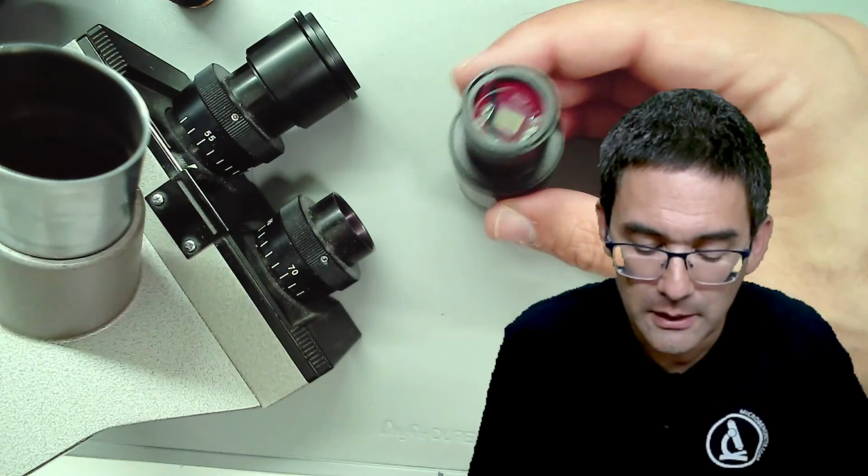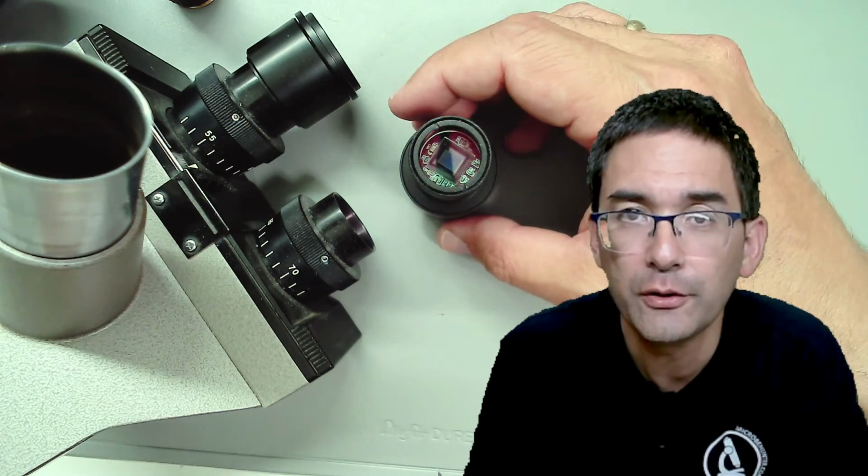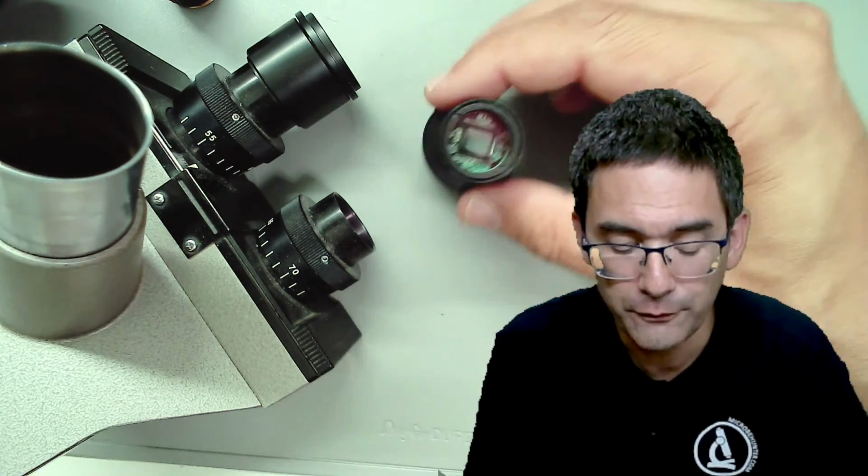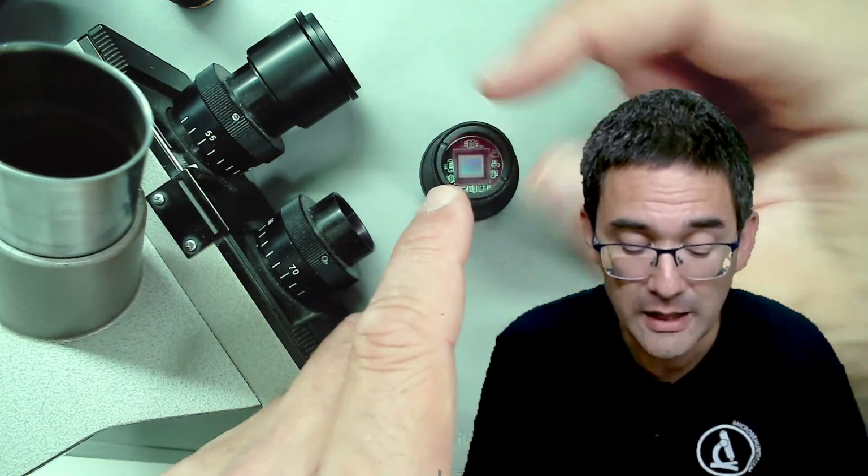So this camera over here has a similar problem in the sense that you do have a very narrow field of view. So if you want to get a wider field of view, then essentially the sensor should actually go all the way to the edge, all the way to the side.